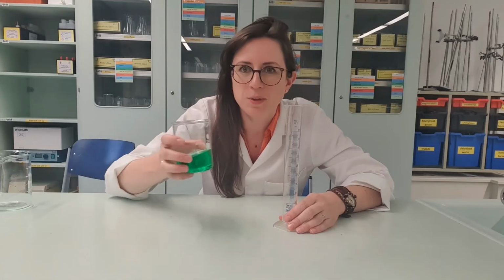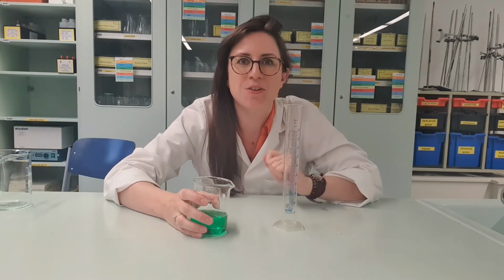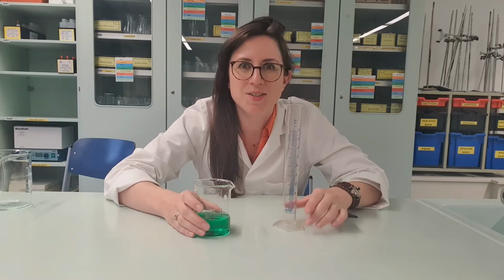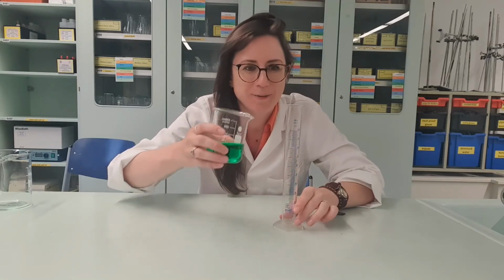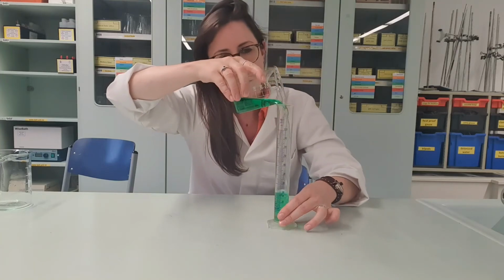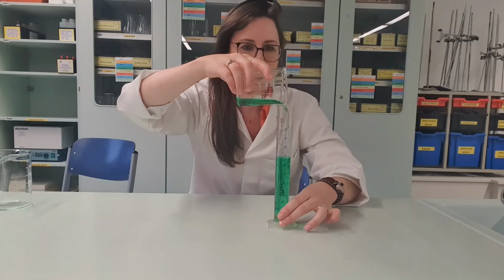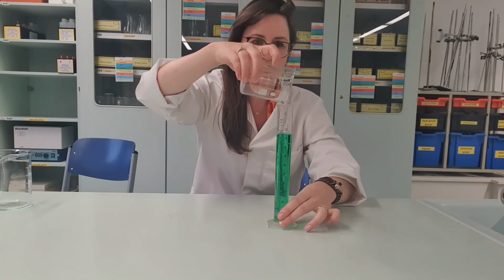So now I'm going to transfer the liquid that was in my beaker into a measuring cylinder, which is the correct instrument to measure out volumes of liquid in science. Let's see how many milliliters was in the beaker. Are we going to get to 100? Not sure. Keep going. Oh, right, every drop.